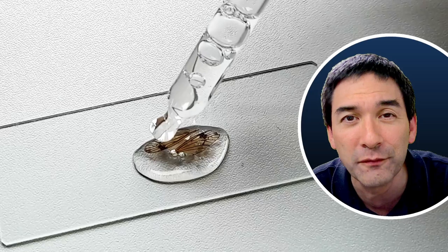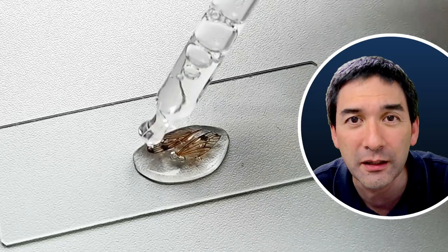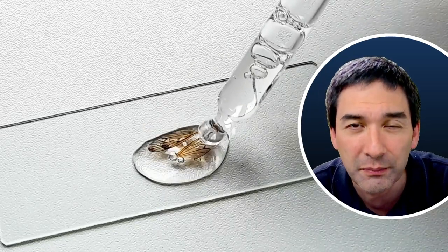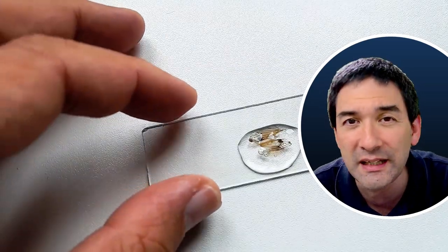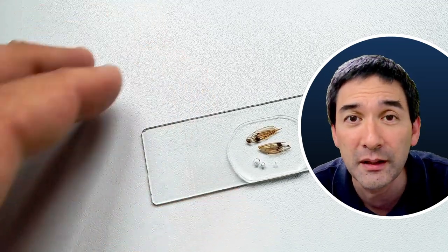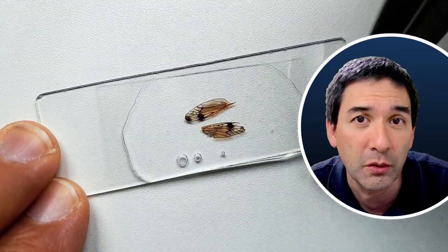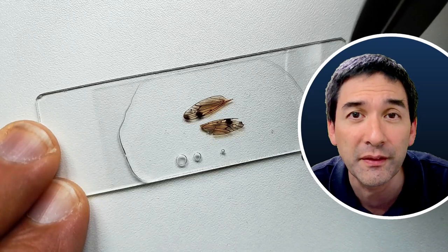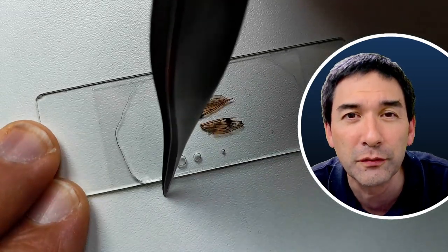When I added some more glue on the surface, it didn't really connect well with the wing. So I tried it anyway. I used a slightly larger cover glass this time because I also used much more glue, and then I had to center everything properly and there was also a little bit of glue spilling out.